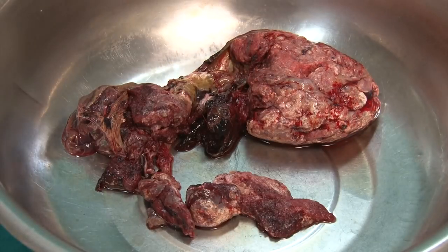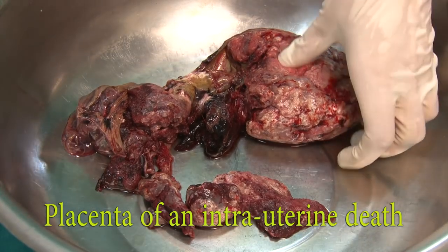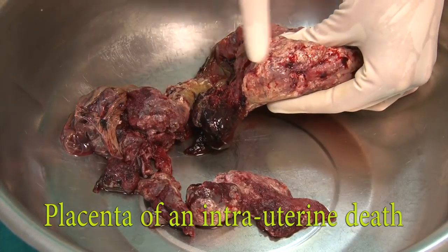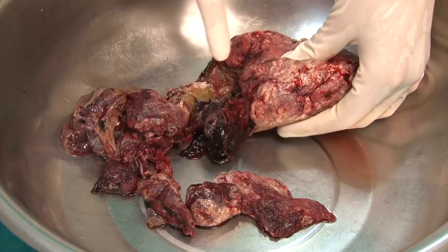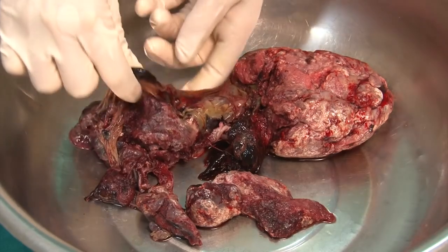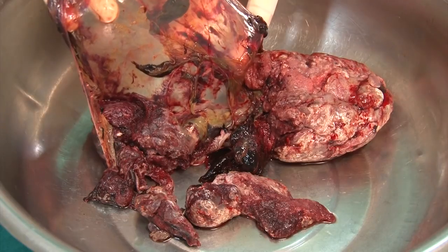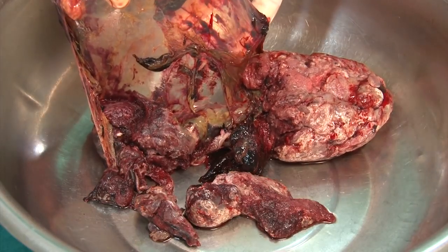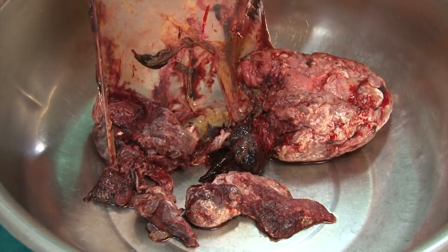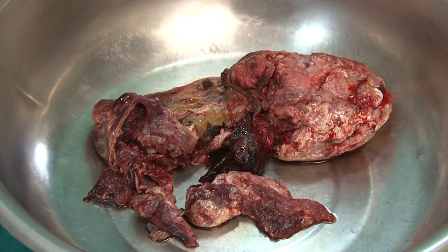This is a grossly abnormal finding, which illustrates a placenta of an intrauterine death. The tissue has an increased thickness and contains a large amount of calcifications. There's a greenish discoloration, and when lifting up the membranes, typical meconium staining becomes visible. The cloudy, opacified appearance suggests chorioamnionitis, which is supported by the foul-smelling odor during the examination. Furthermore, there are blood clots and fragmentation of the placenta.